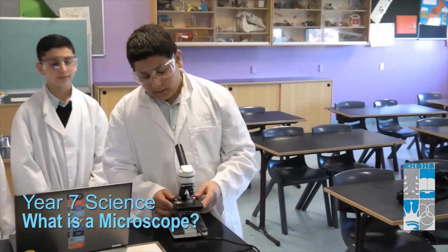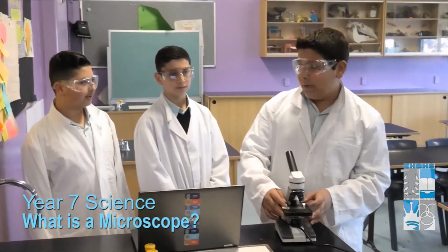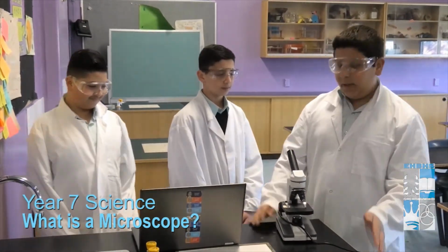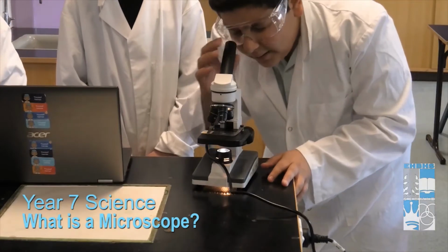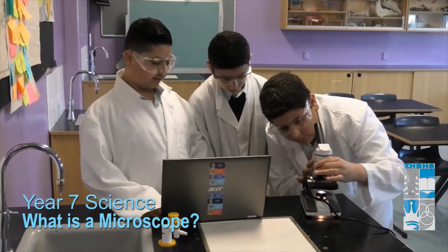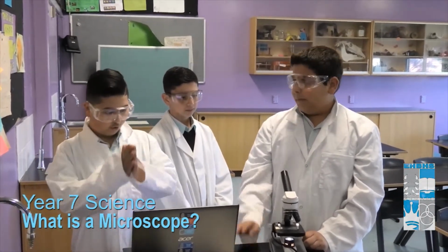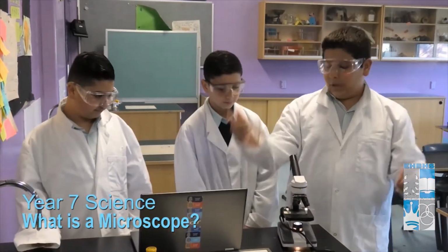Today, we'll be examining a slide of a cat paw. Is that a real cat paw? Yes, it is a real cat paw. First you turn it on, and make sure you're wearing safety glasses so you don't blind yourself with the light. You turn on the light, make sure it's steady. Does the paw go left or right or just in the center? It goes in the middle, because the objective lens isn't focusing all around, it's just focusing in the middle.